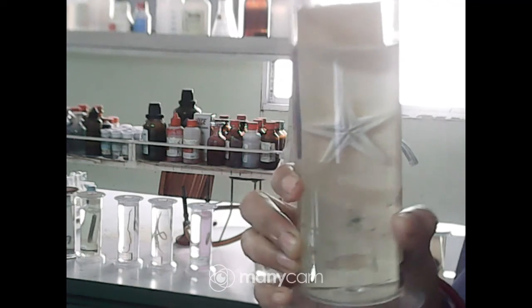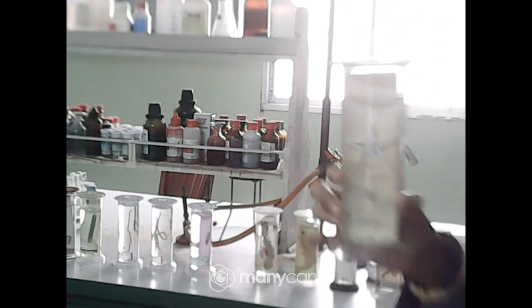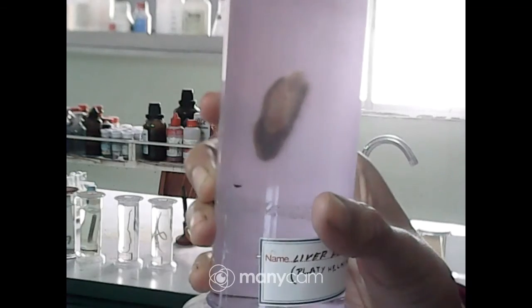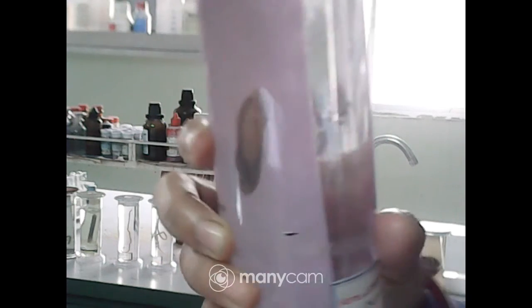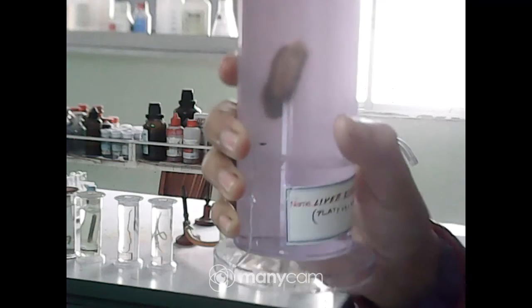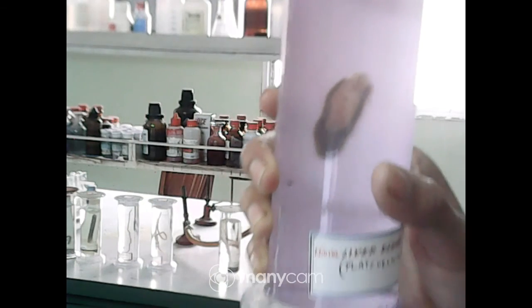Write it down right now. After finishing all the practicals you have to submit. I will inform all of you when you have to submit your practicals. Here is the liver fluke — Fasciola hepatica.